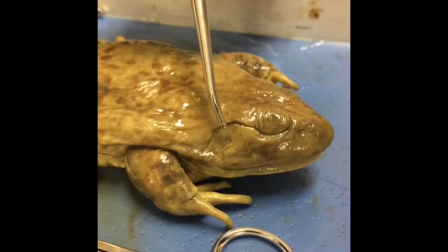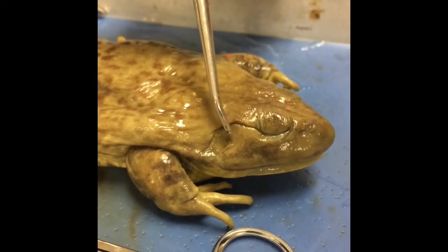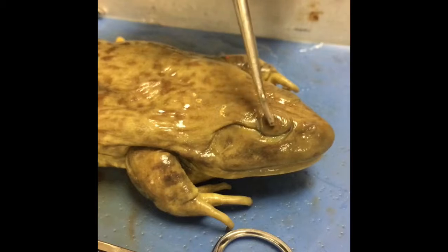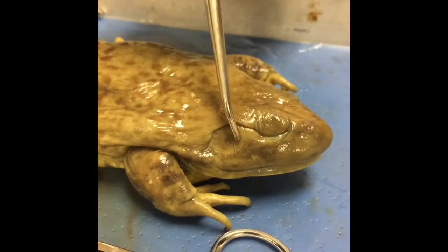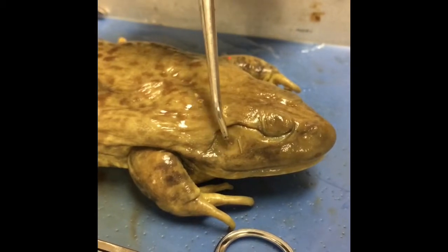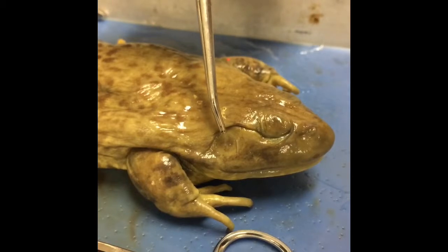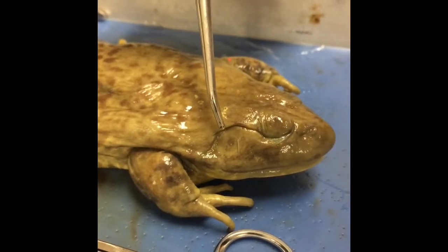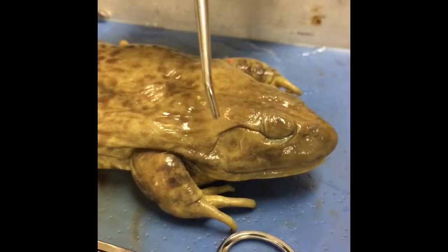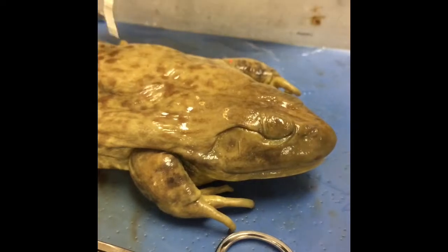Here we have the frog's tympanic membrane, also known as the tympanum, which is the circular patch of skin behind the eye. It functions more like an eardrum. The tympanum transmits sound waves to the middle and inner ear, allowing a frog to hear both in the air and below water. In addition, this membrane serves to keep water and debris from entering the frog's ears, such as on the American bullfrog we have here.